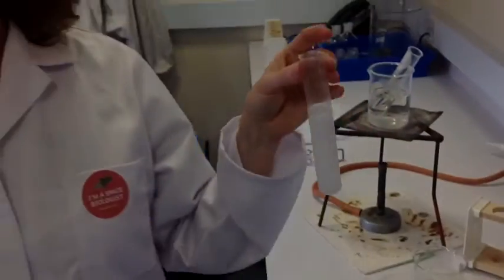Next, what you are going to do is take these and put them through the vacuum pump again like you did last week. You may need to loosen them up a bit with a glass rod, and then when you have done that, put them on a watch glass into the tray provided for next week.